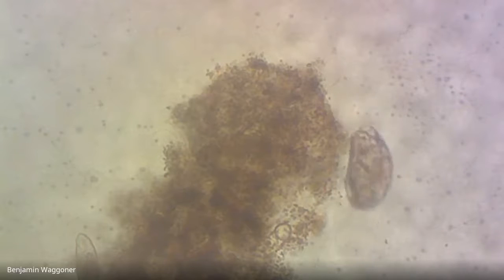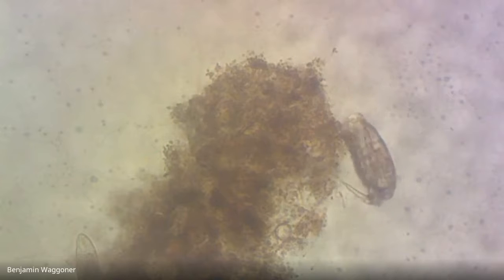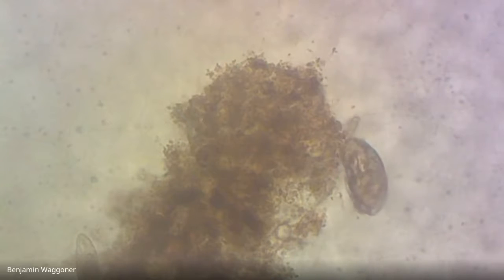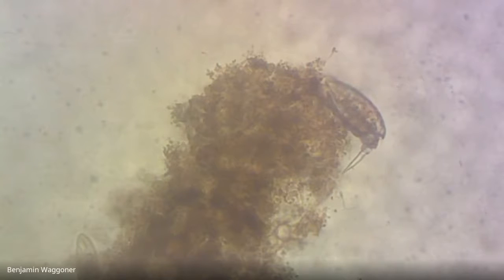That's the rotifer jaws. That's the trophi kind of embedded in an assembly of muscles collectively called the mastax. And those function as essentially jaws. So if you see something with jaws clicking back and forth, and something where the body looks like it's divided up into joints, almost but not quite like a shrimp or something, it's a rotifer. It's not actually a ciliate.